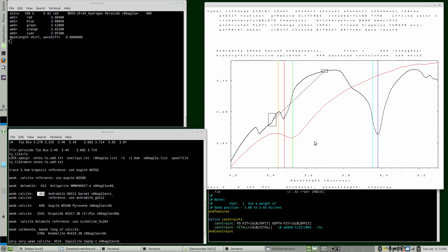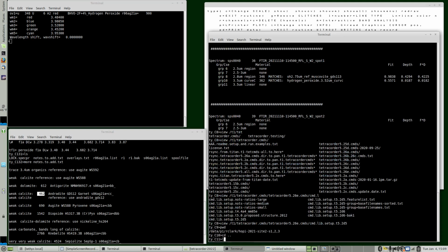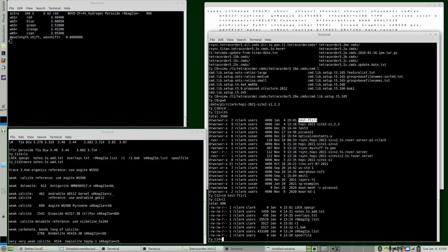And so I spent some time, and I'm not going to do that too much here. I'll do an example. So we don't need this. I actually need to go up to my test directory that I'm working in. So now all three windows here are in the same directory. And I made listings of the spectral libraries here, so I'd have them for my reference, and I could even take notes or edit them with changes if I wanted to.